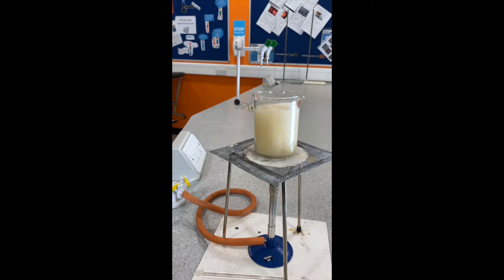The safest and most efficient way to prevent any over-boiling of the liquid and to remove the source of heat is to turn off the gas tap. Do not attempt to move the Bunsen burner from underneath the tripod as this may cause the hot liquid to spill.